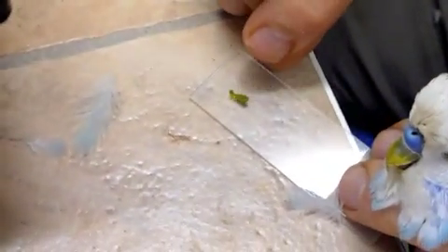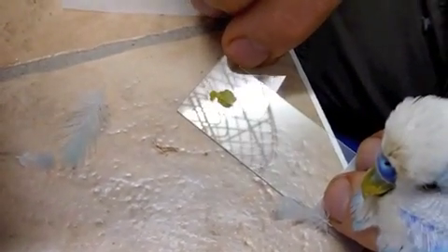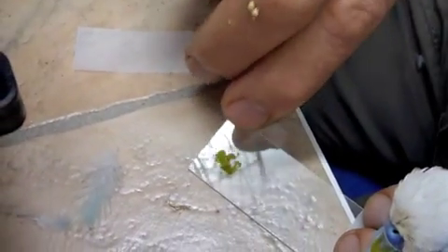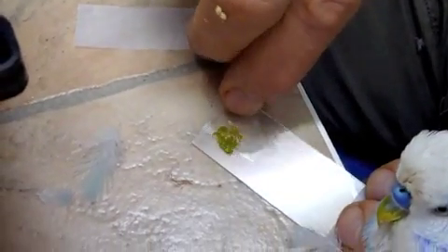We're now taking a small dob of faeces and spreading it out a bit. The first thing I notice is that there's undigested food particles in it — I can see little bits of seed in it, so he may be lacking sand grit in his diet.